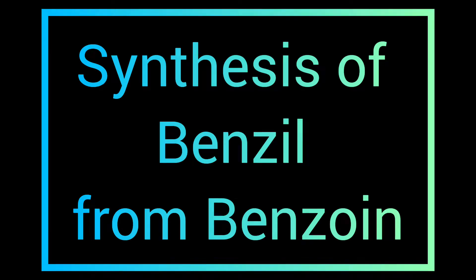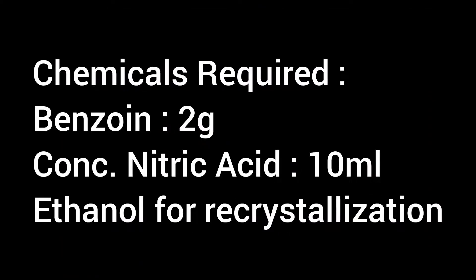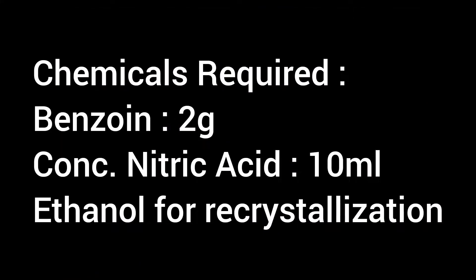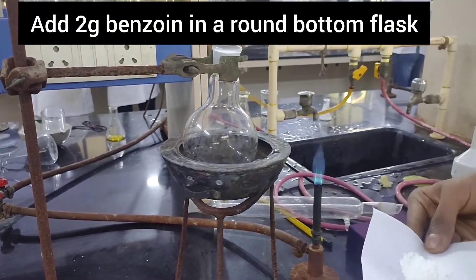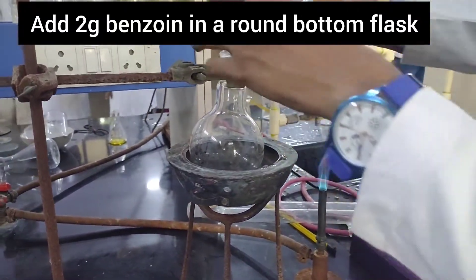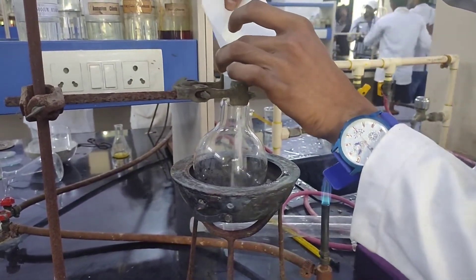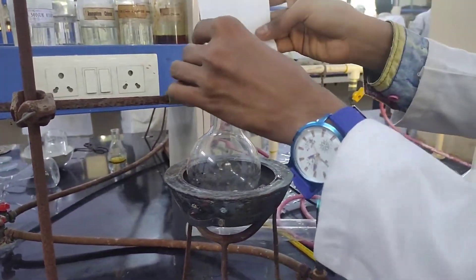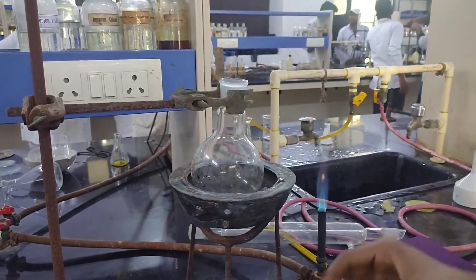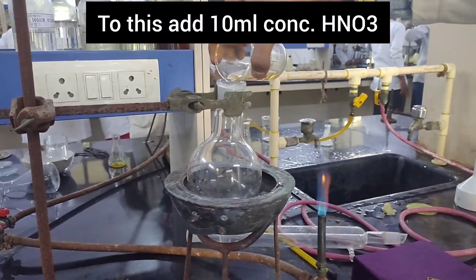In this video, I will be synthesizing benzil from benzoin, and these are the chemicals required. I have set up a round bottom flask on a clamp, and to it I am now adding 2 grams of benzoin. Now to this I am adding 10 ml of concentrated nitric acid.